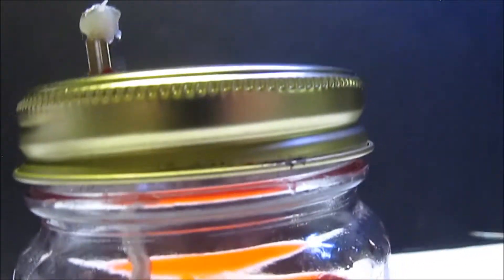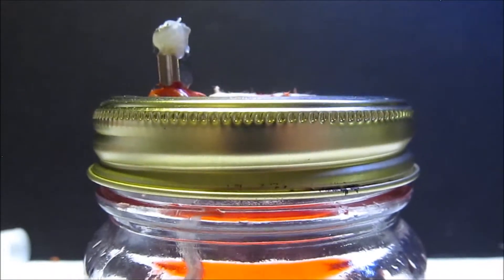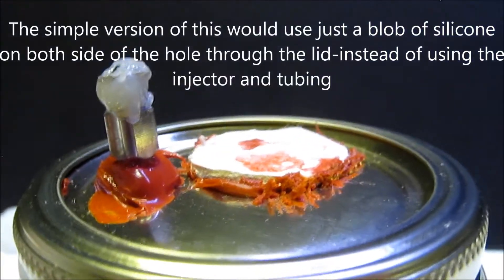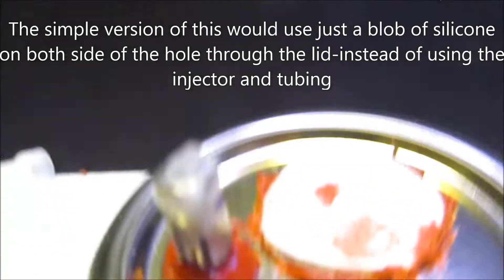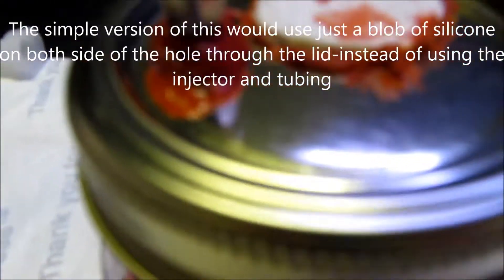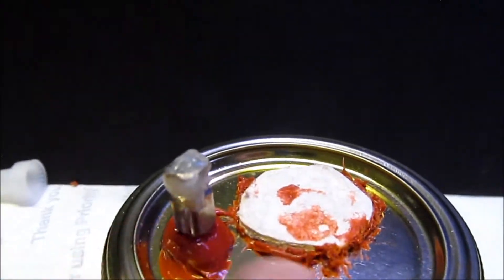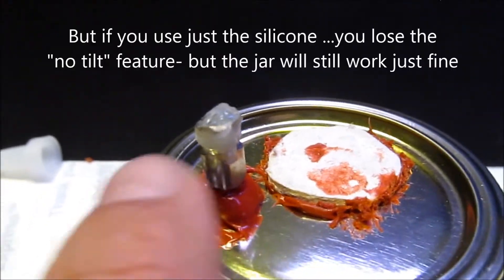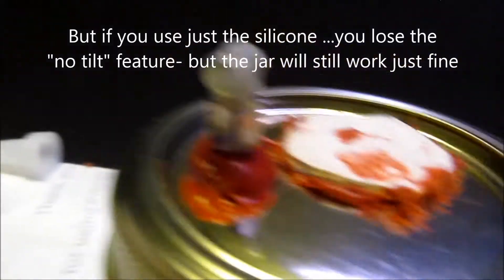Basically, we have a small mason jar with an airtight synthetic filter disc on top and an injection port on the other side. Here's our filter disc and our injection port.